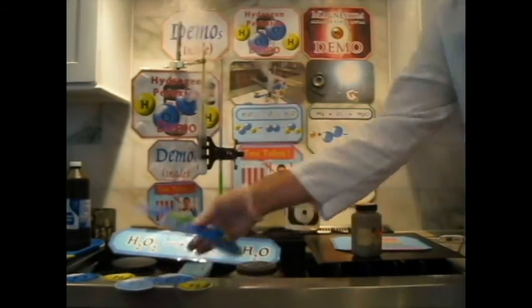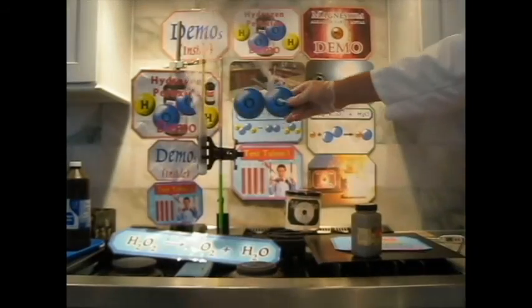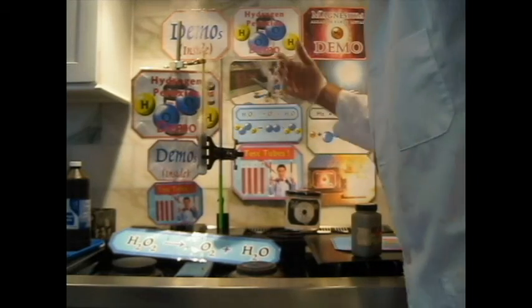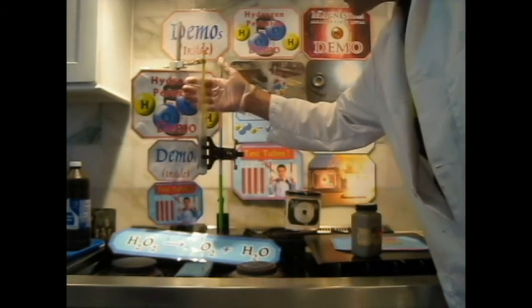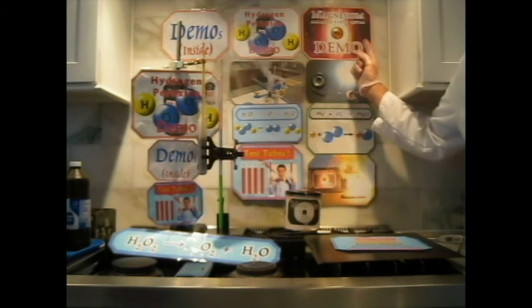So the great thing about that reaction is that it provides us with one of the things we need for our next reaction, which is actually the oxygen. That's one of the things we need. So I'm going to let that reaction keep going. That's going to accelerate our next demo. Okay? So notice I'm not in harm's way being right here, because what's being given off is actually oxygen and water. That's what that is. So I'm not being harmed here, but there's extra oxygen in this area. Maybe we can take advantage of that in our next demo. The next demo is the magnesium demo.